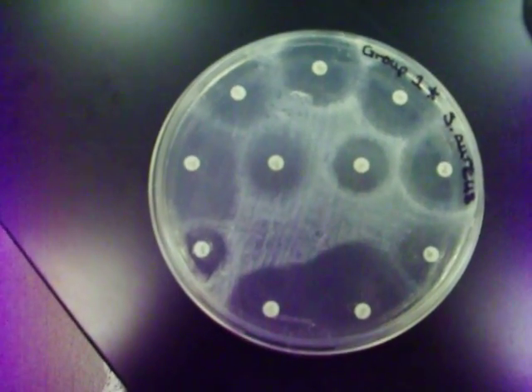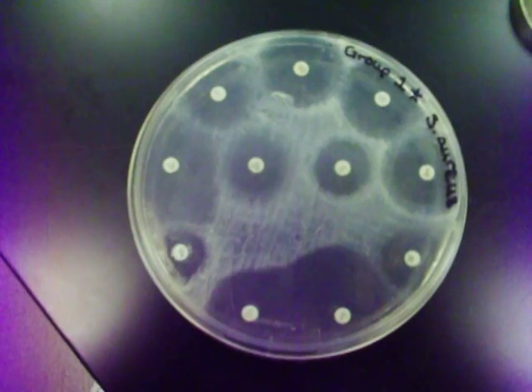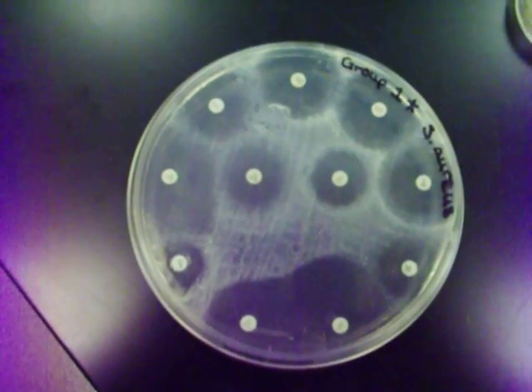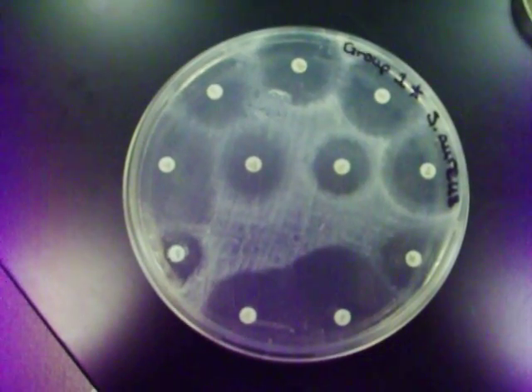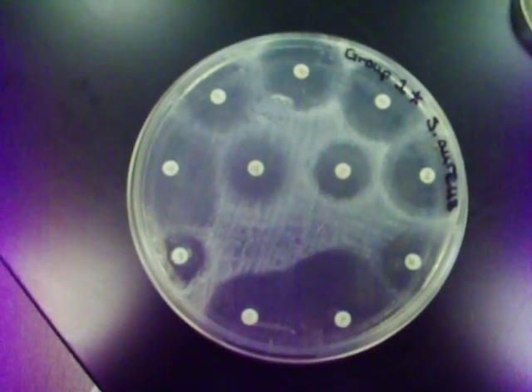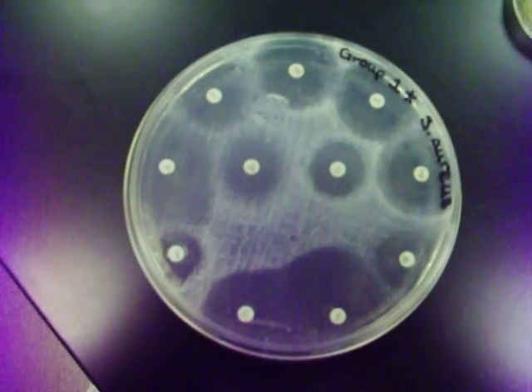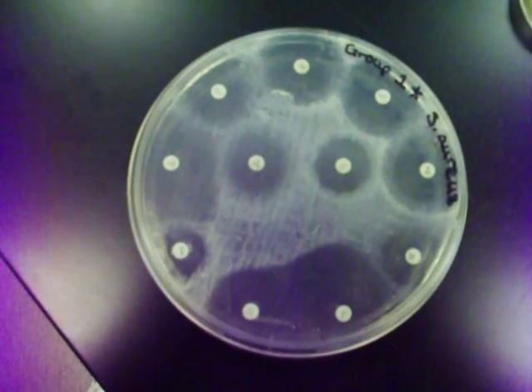This is the Kirby-Bauer test and it tells you if bacteria are sensitive or resistant to different antibiotics.